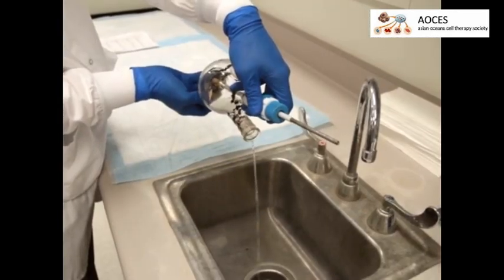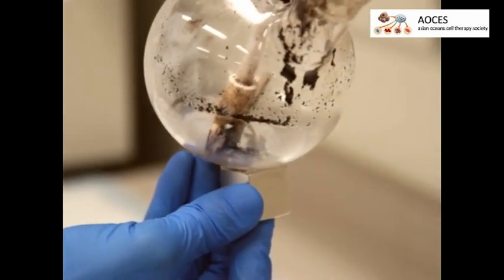After stirring, decant the excess liquid while holding the nanoparticles at the bottom of the flask with a strong magnet.